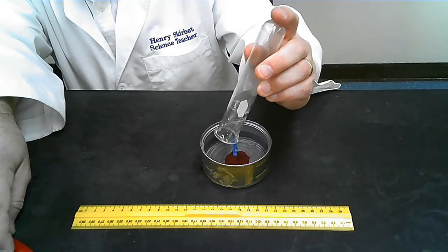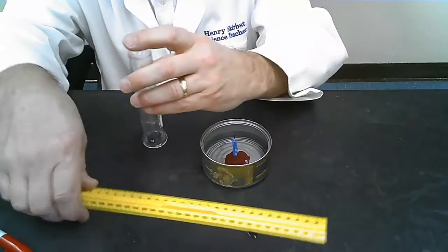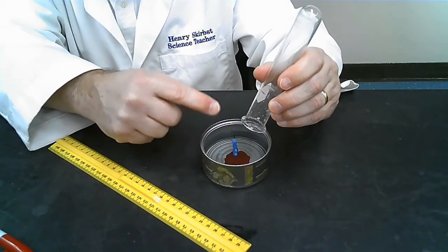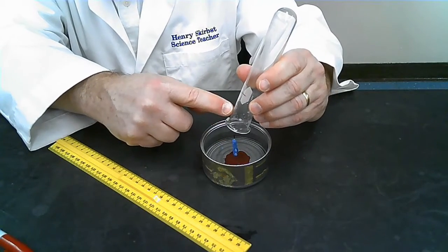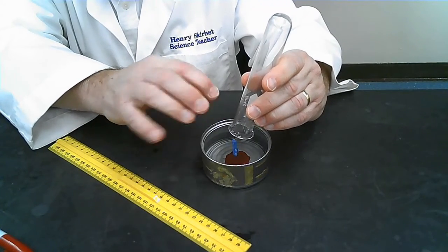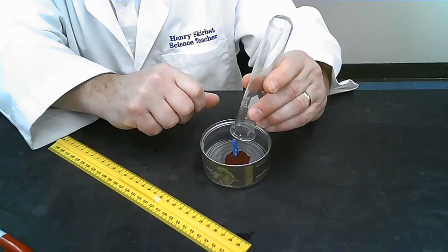So here I have a little red mark on the test tube, and I'm going to make some measurements here. Now think about why the water level went up. I'll explain it to you. The candle was only burning oxygen. When the candle was burning inside the test tube, only the oxygen was being burned, not the other gases in the atmosphere, not the nitrogen, not the carbon dioxide, only the oxygen. So the candle only consumed the oxygen.